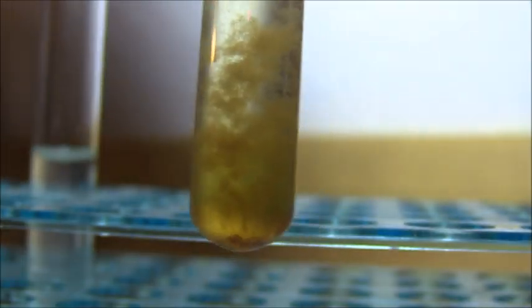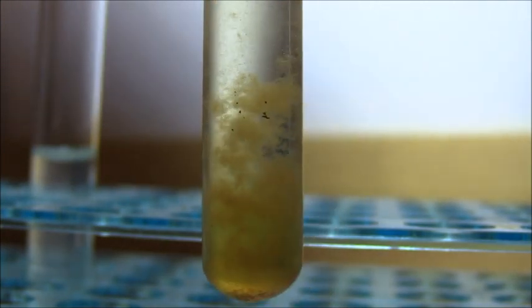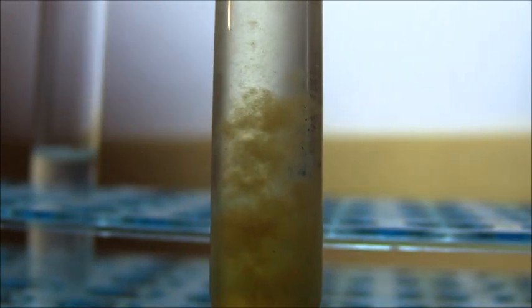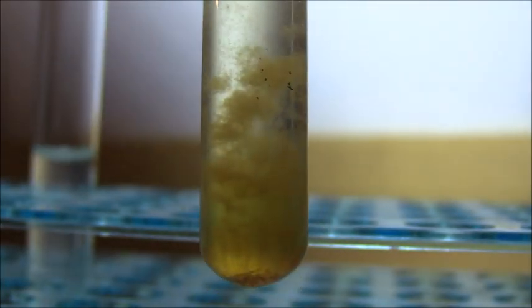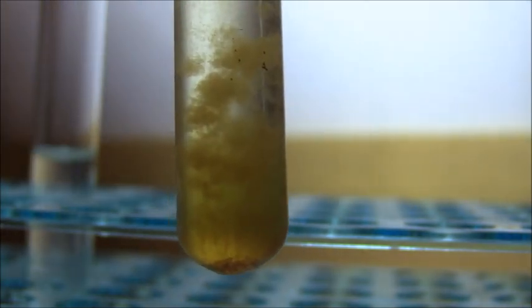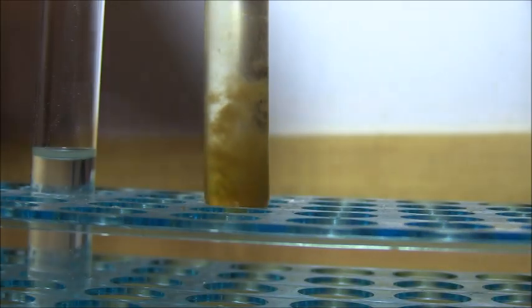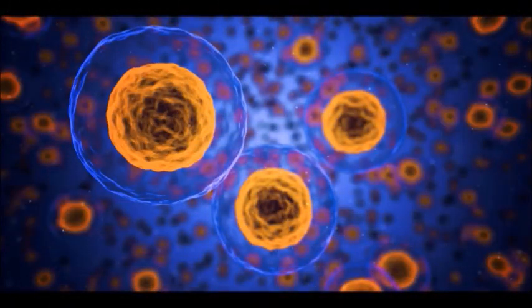Hello, YouTube. Well, I just wanted to film a quick extra segment. This is what I was looking for in my result before. I let this settle out for at least 20 minutes. And this is the desired result. And you can see we have a light brown precipitate in great quantity now. So this is what I was actually expecting to see for the positive test for purines. So I just wanted to add that. And that's it.